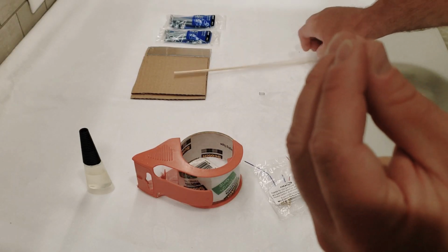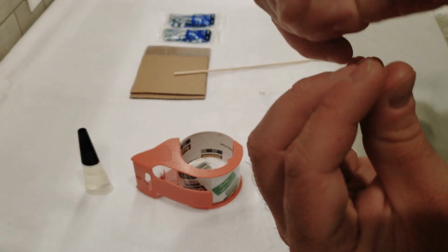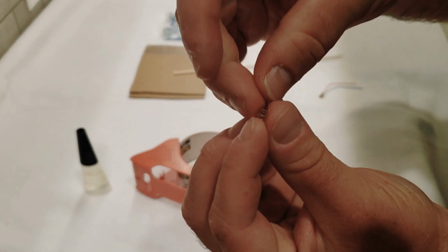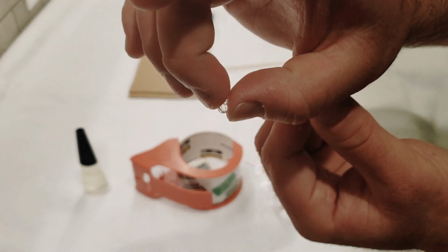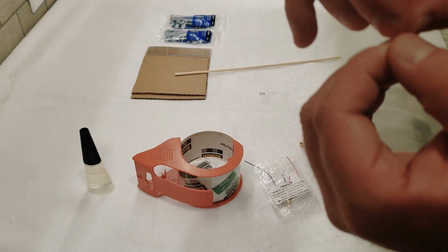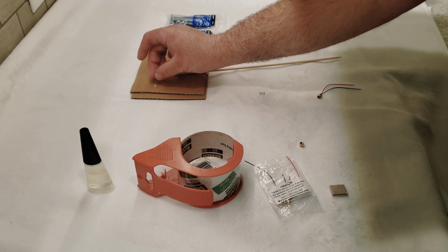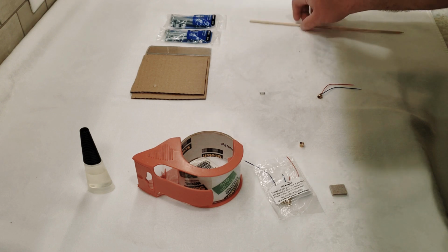So we're just going to go in and kind of poke the lens and set that to the side. There you go, there's our tiny little laser lens. And that is just one that we need. Let's set it on that cardboard so we don't lose it.